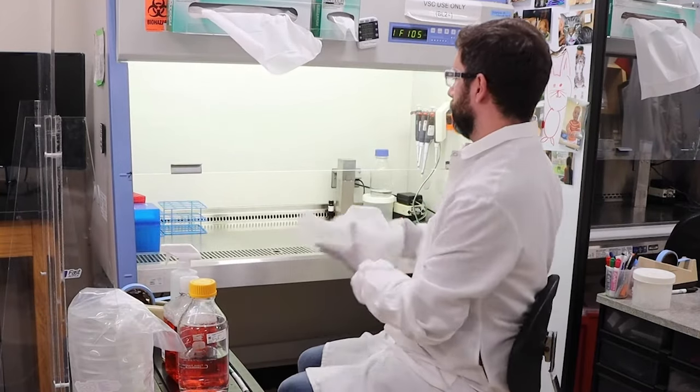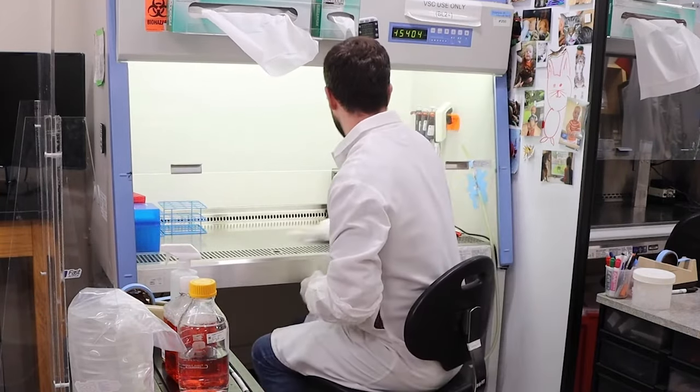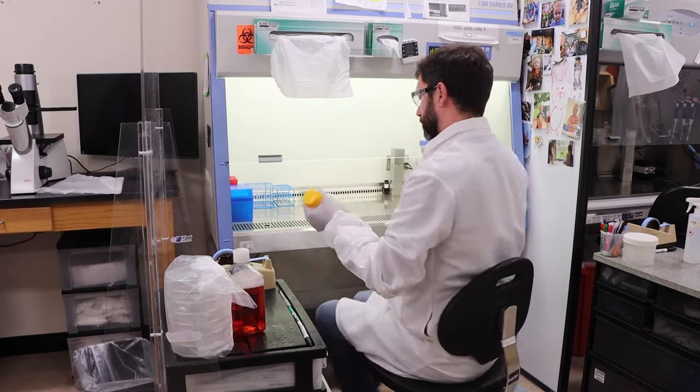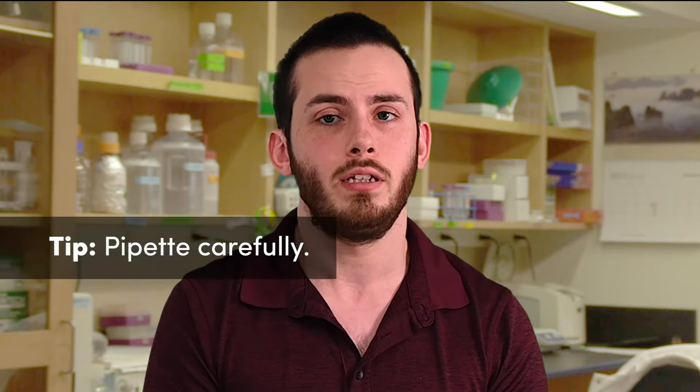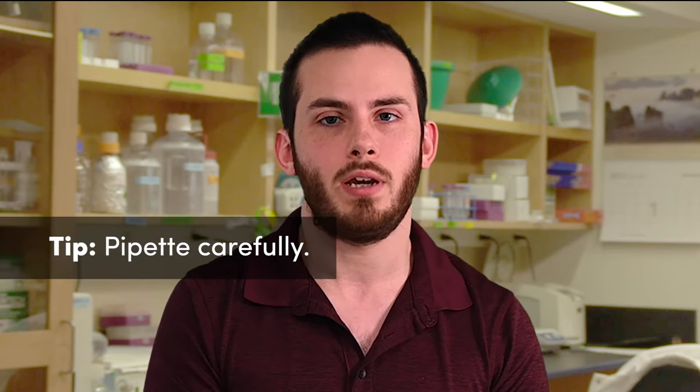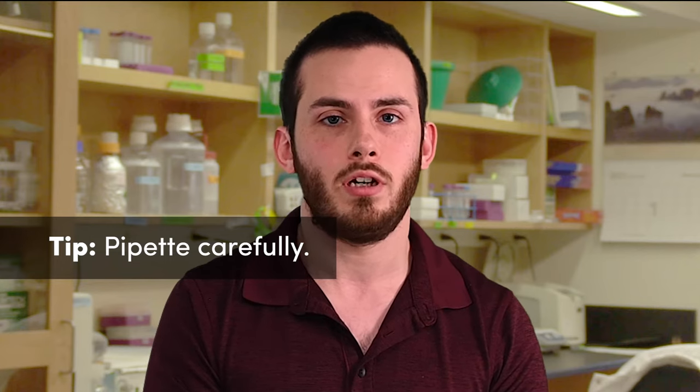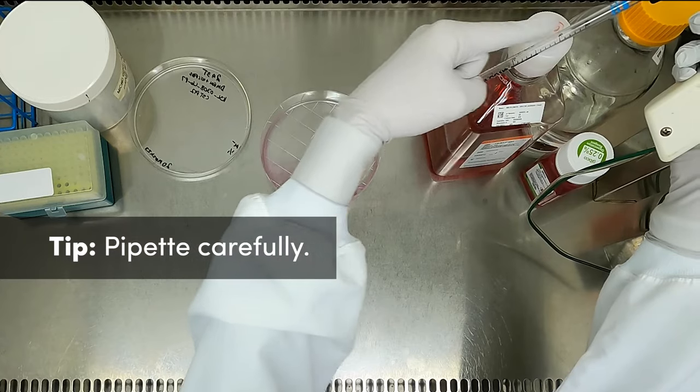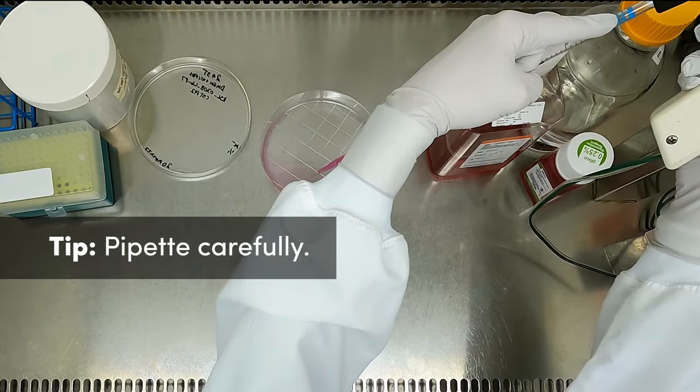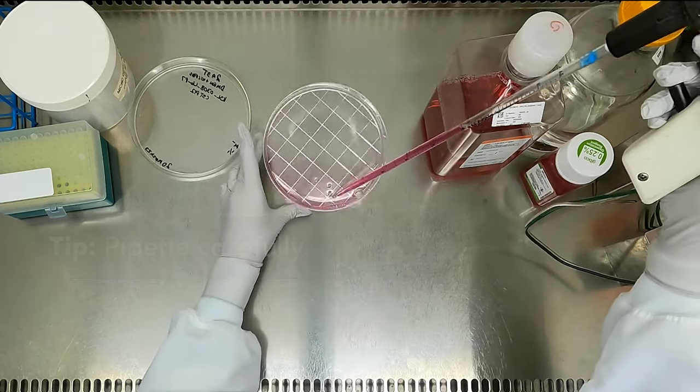You can watch our Tech Tips video on sterile technique by clicking the pop-up link in the corner. In addition to the do's and don'ts covered in that video, let's also take a second to highlight the importance of pipetting carefully. If you draw too much liquid or air bubbles into the pipet, liquid droplets could contact the filter or enter the pipet aid, and create the possibility of contamination. So keep an eye on your pipet and take your time.